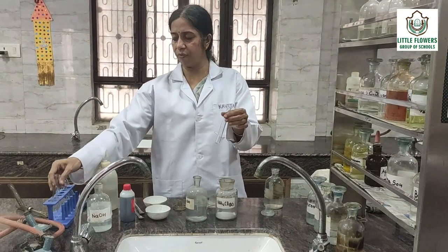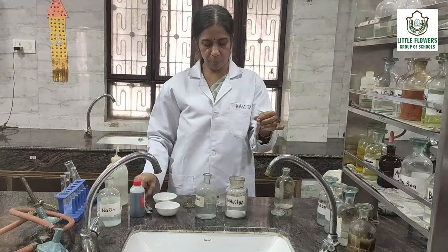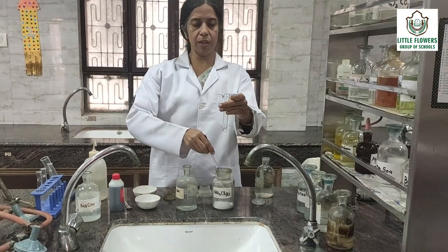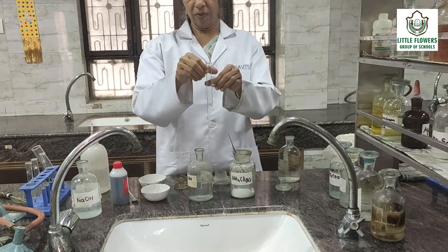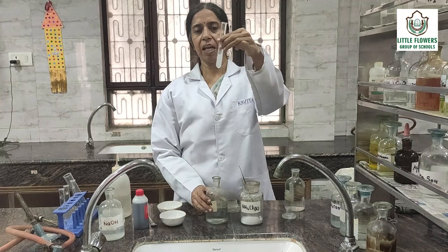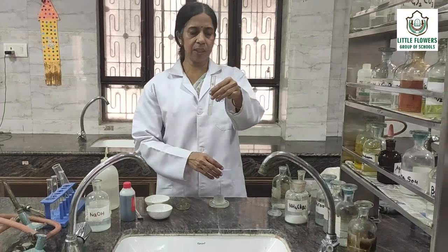For Group 3, the reagent is NH₄Cl and NH₄OH. We will add NH₄Cl to the salt solution and prepare a saturated solution. Now we will add NH₄OH. You see — a cotton-like PPT has formed. This shows Group 3 is present; Al³⁺ may be present. Now we will dissolve this PPT in dilute acid.